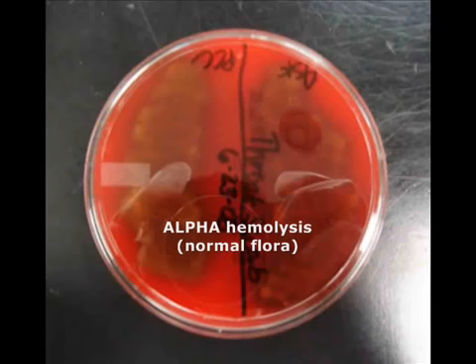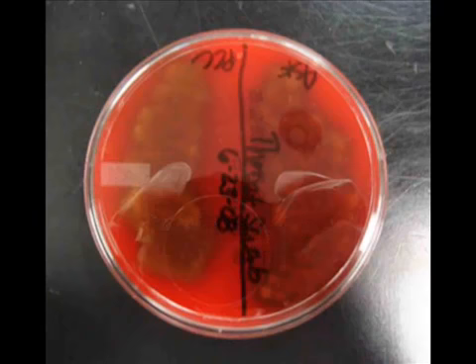Here's another blood agar plate with the same type of hemolytic reaction. The samples plated on this blood agar were throat samples from two different lab partners, and both show alpha hemolysis, that brown bruising color. This indicates normal flora.